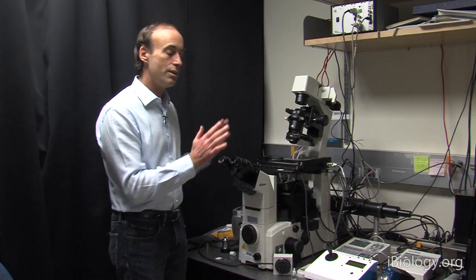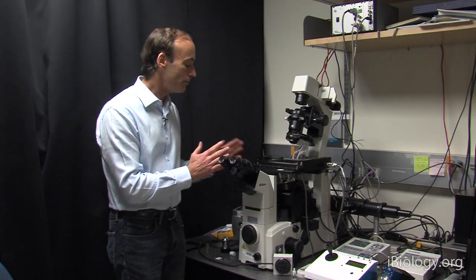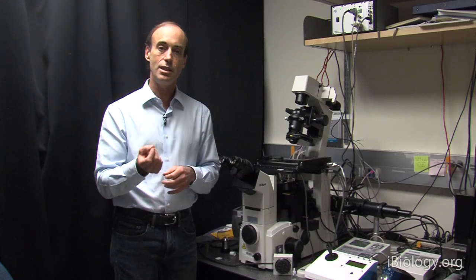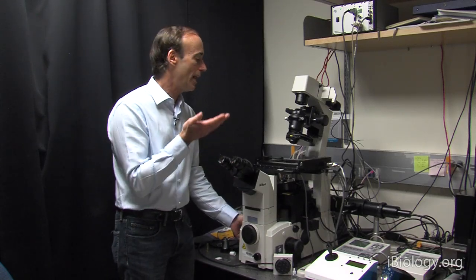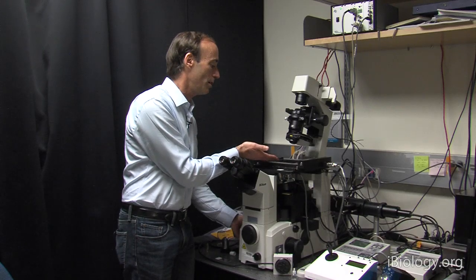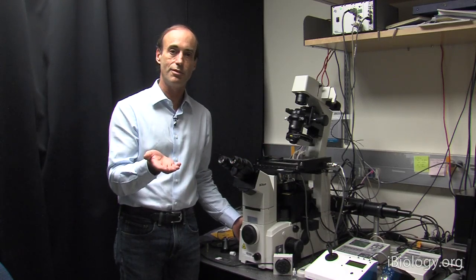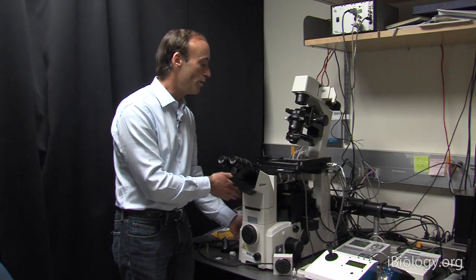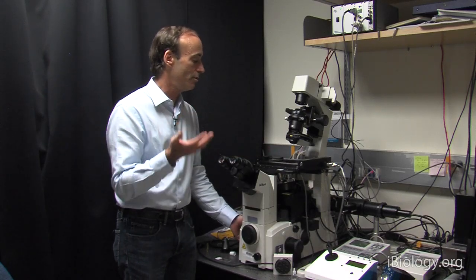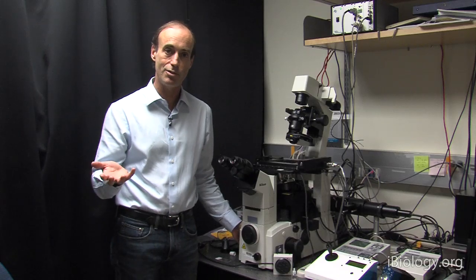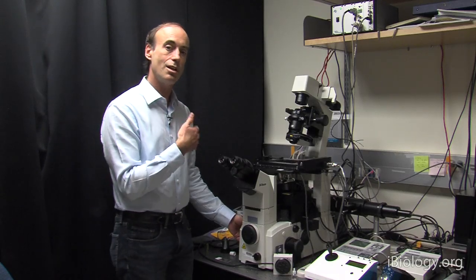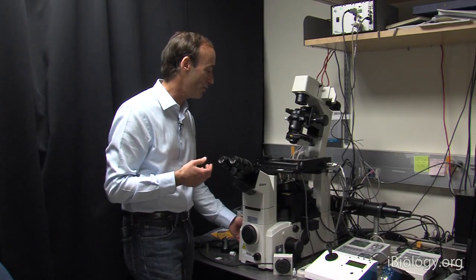Before I even put the sample on, I want to get used to these focusing knobs, in particular knowing which direction I turn the knob and how that will relate to whether the objective lens moves either up or down. The direction of focus can be different in different types of microscopes, so it's important to become familiar with your particular microscope.